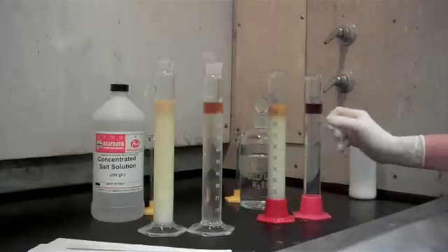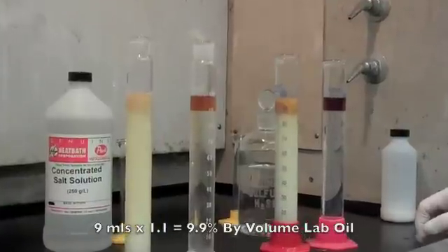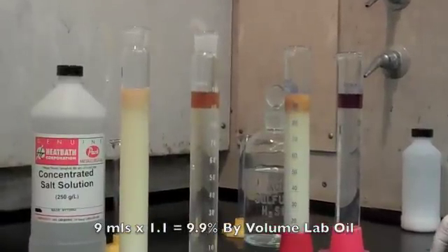Again, take a reading. It's 9 mL times 1.1 and that's 9.9% by volume.